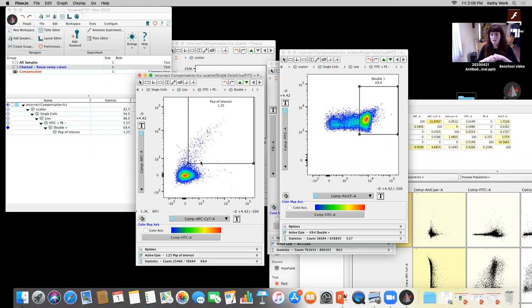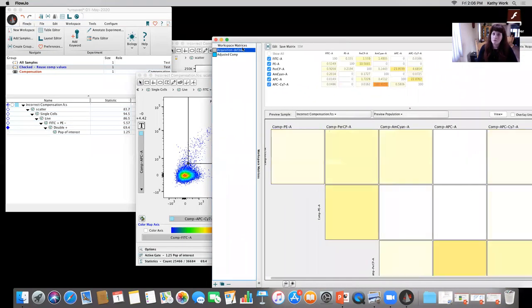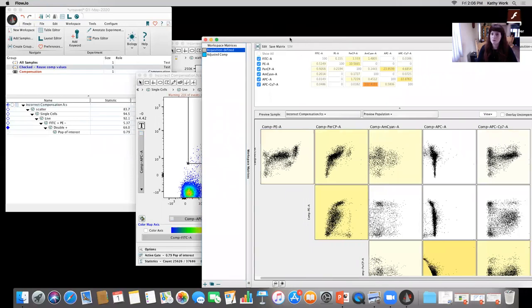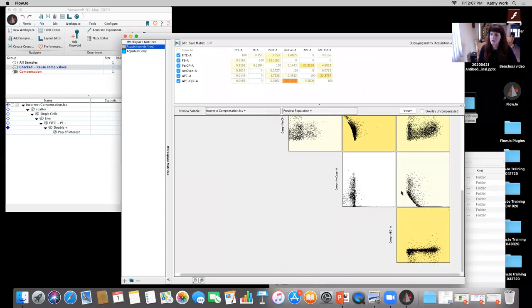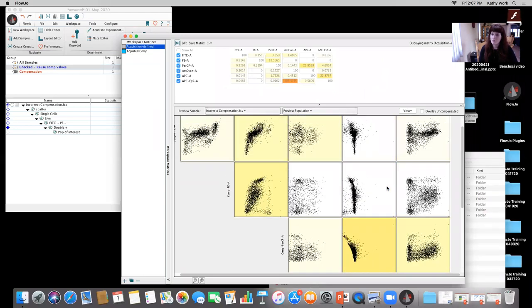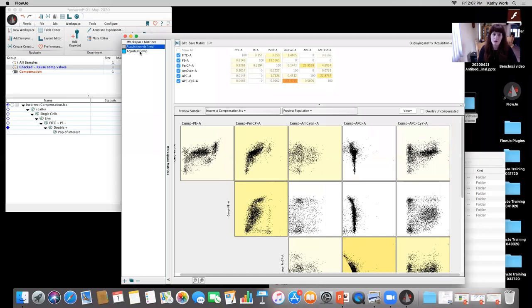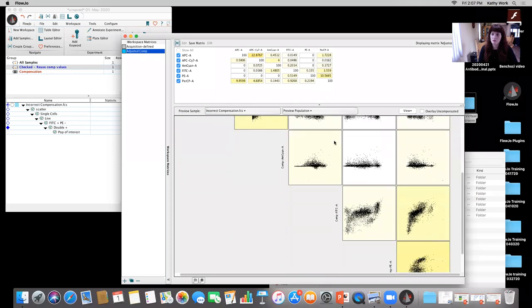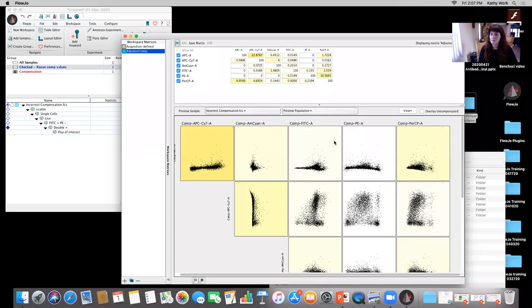Your statistics won't make sense when we're talking about those extreme negatives and all of that. It's just not going to be appropriate for your analysis. So this is my lesson in assuming that you can utilize previously used compensation matrices, right? We see very clear issues with the compensation. We see super negatives. We see a lot of issues there. And then once we have run the appropriate controls and redo the compensation calculation, that's gone, okay? So be very mindful of that and do not reuse compensation controls.